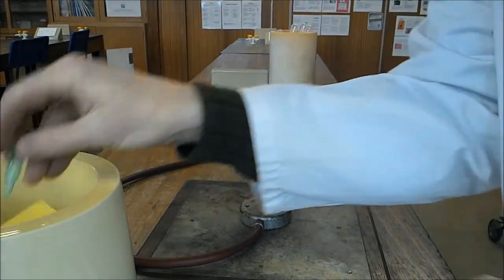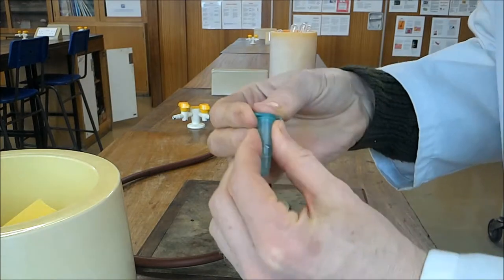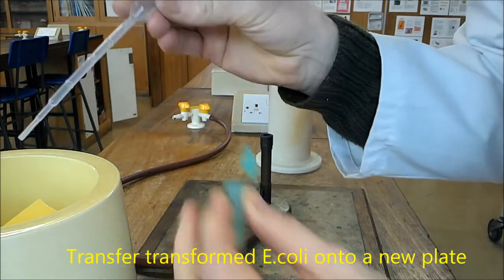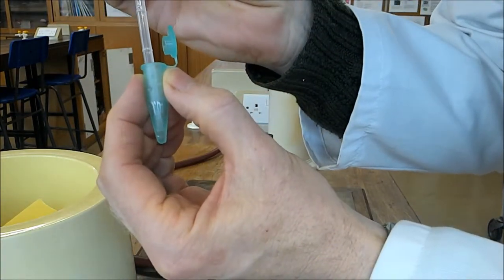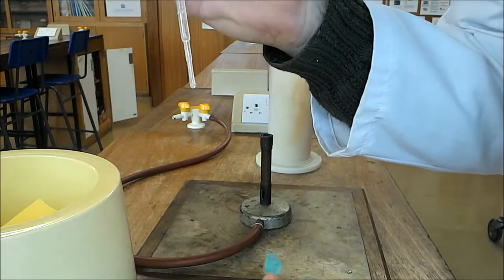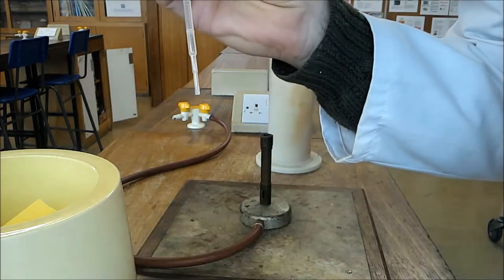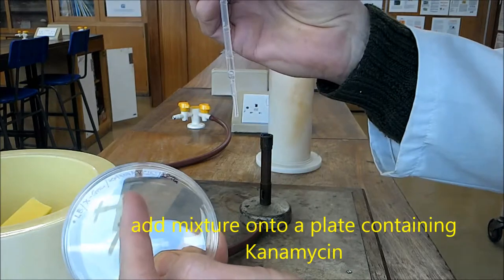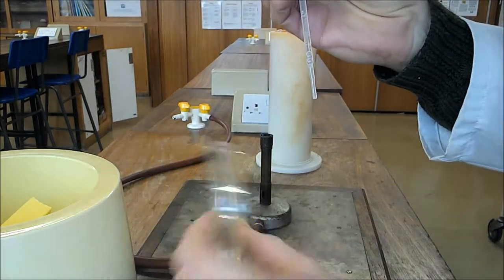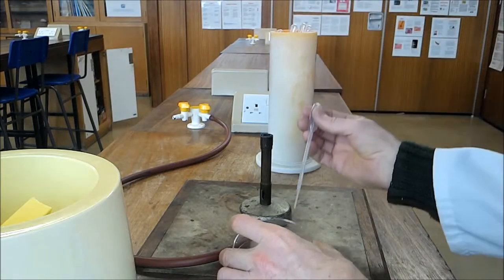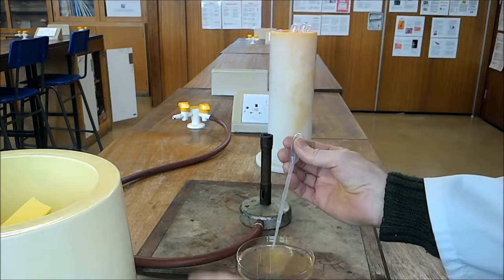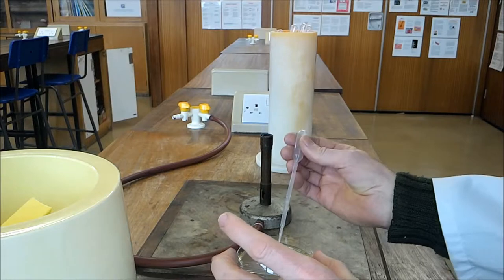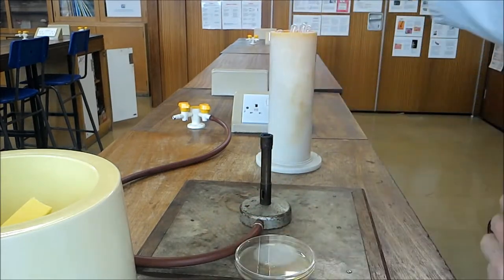After 15 minutes, we take the plasmid suspension with the bacteria, take a sterile pipette, and we're going to take out the solution. Okay. Antibiotic. Put three drops. One, two, three. And this is contaminated, so into disinfectant.